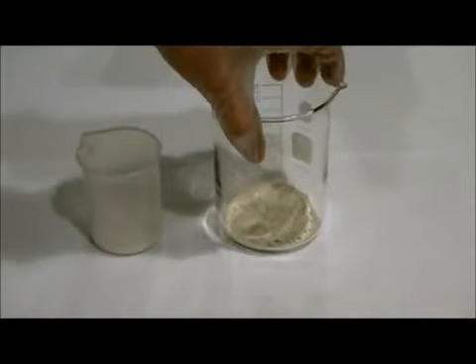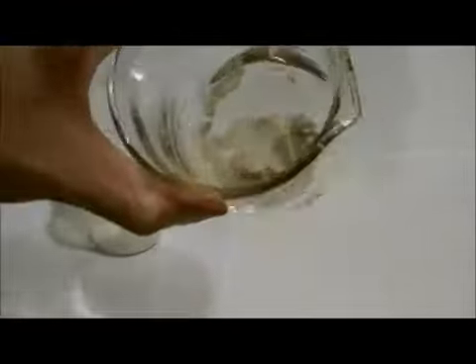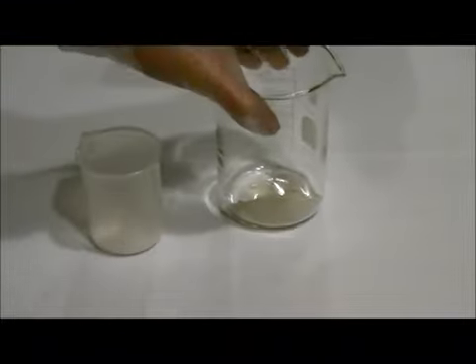Hello and welcome to the NACLAB. Today we'll be synthesizing iron oxalate from 10.12 grams of iron sulfate and 6 grams of oxalic acid.